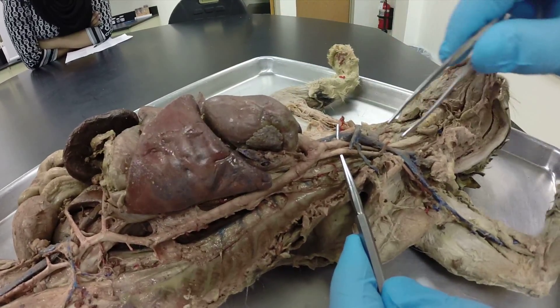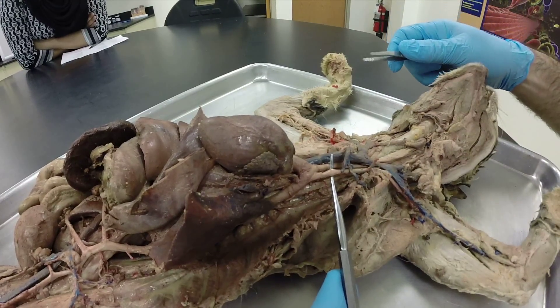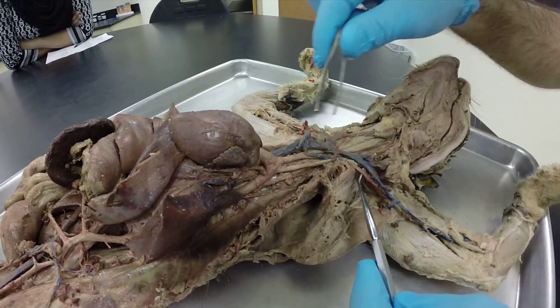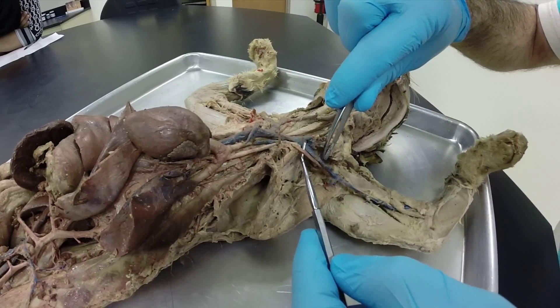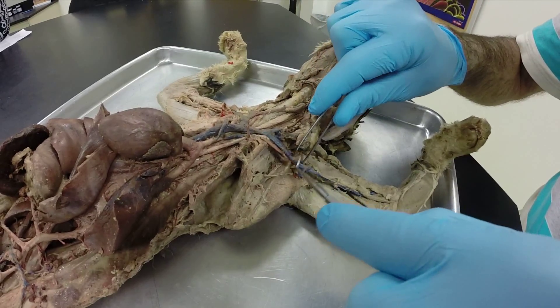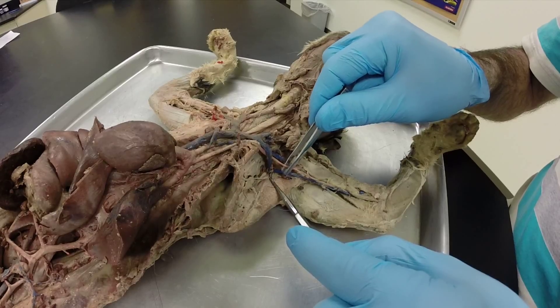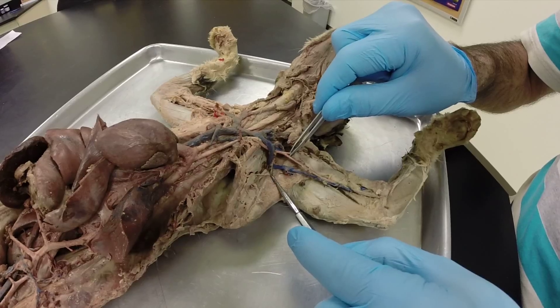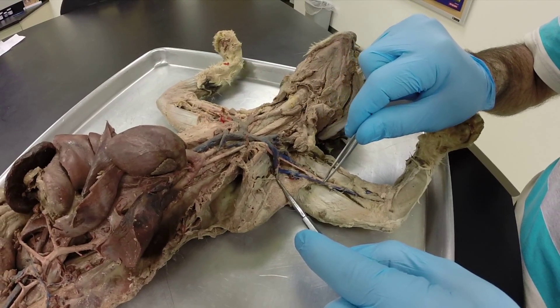Coming off the aortic arch we have two vessels. This first one is the left subclavian artery, and that's going to travel up. Once it makes its way over to the axillary region we call it the left axillary artery. This is going to keep going and branch into the left brachial artery and the left subscapular artery. The brachial artery continues out across the arm.